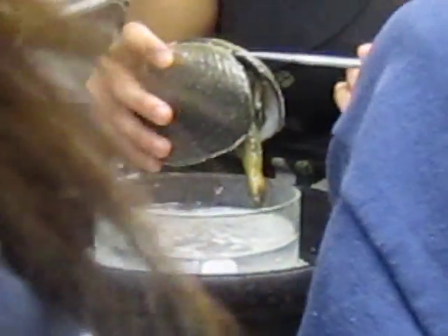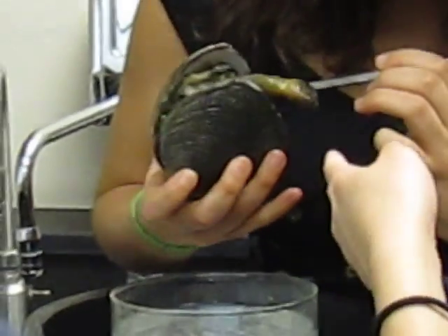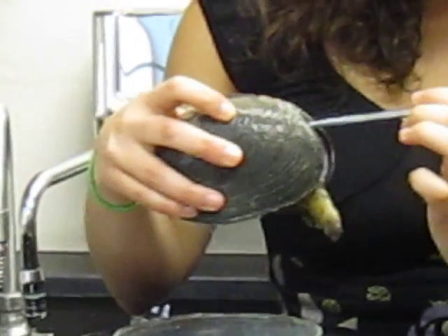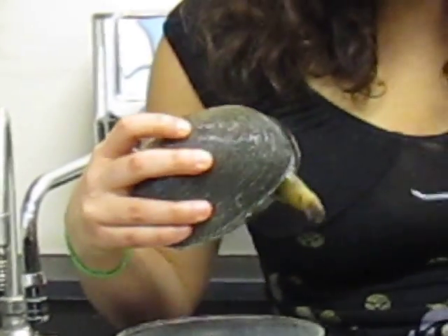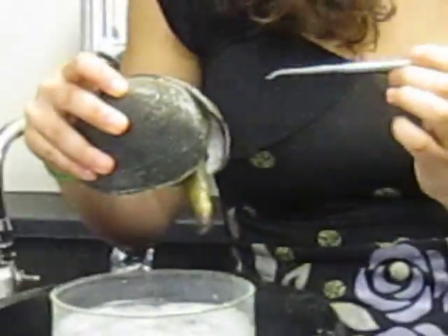Just go up and look at it. So this is the visceral mass in here. It's been cut open. You can't really see that much, and I'll make sure to point out the structures that you can't see. That's outside, and I'm just going to tell you. Not really. It's in there. Yeah, so take a picture of that.